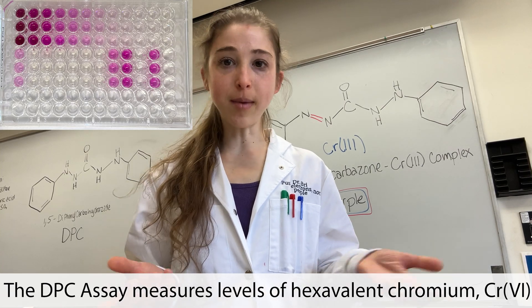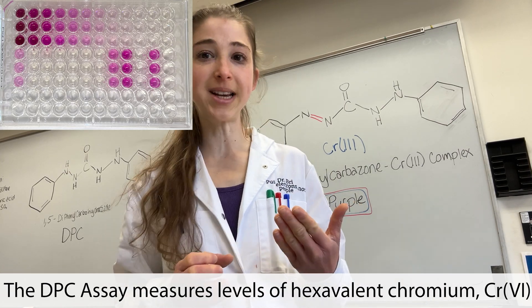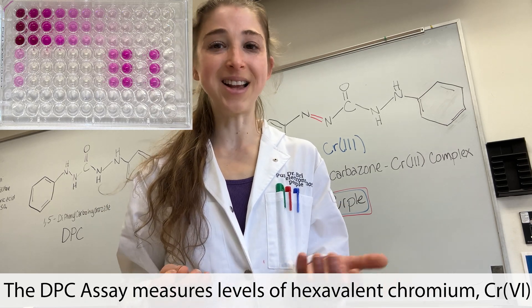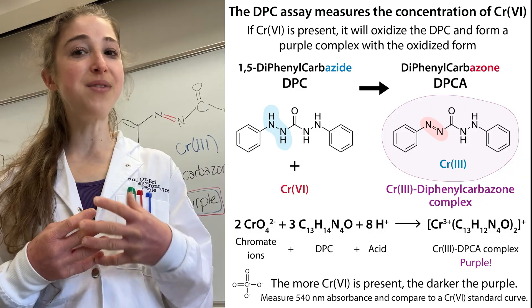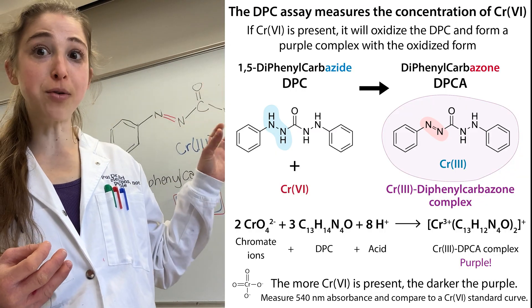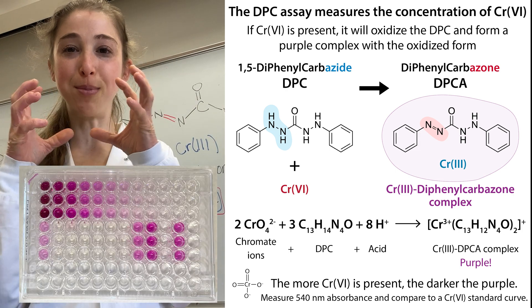One of the main reasons the heavy metal chromium is so toxic is that its hexavalent chromium form, chromium-6, acts as an oxidizing agent. It can attack and oxidize things, which is bad in your body, but we can take advantage of that oxidizing property in order to oxidize a chemical that forms a different chemical that will look purple.